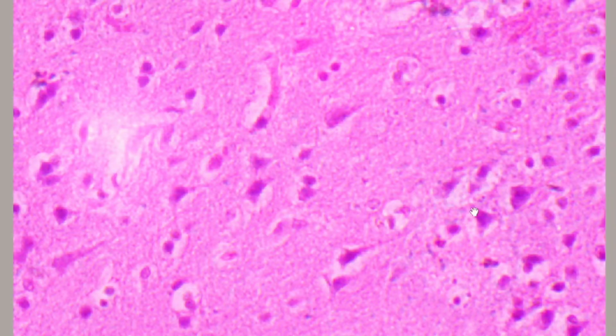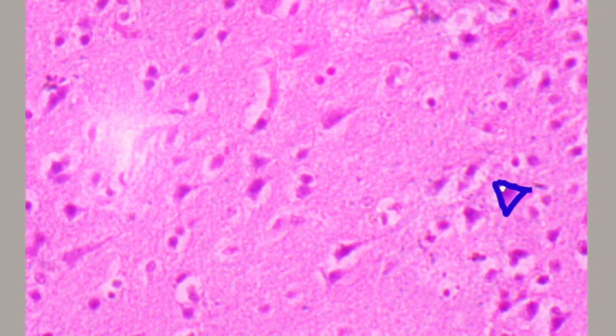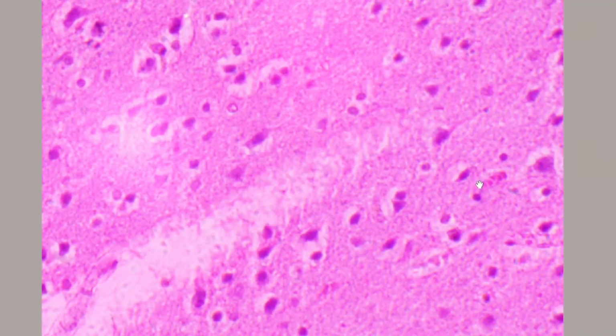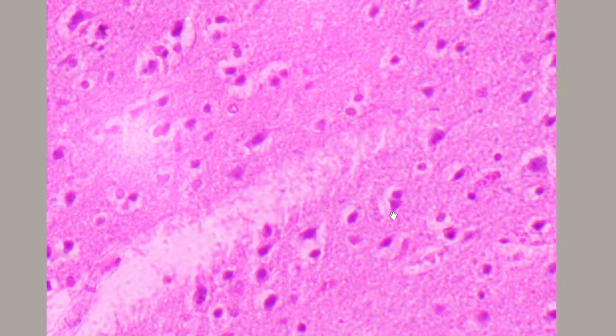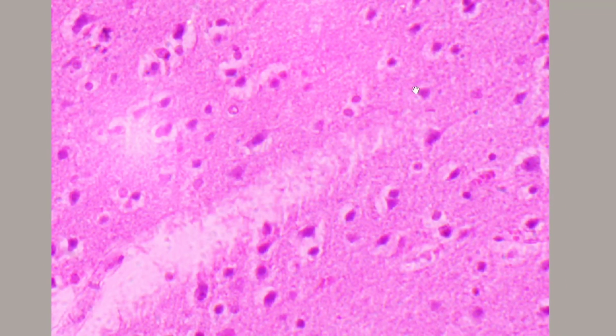So my dear students, whenever you are having the cerebral cortex, you should make sure that you are able to identify such kind of triangular bodies of these cells. And if you are able to identify even one or two such triangles in your exam, it is more than sufficient to label this slide as a nervous tissue, and in the nervous tissue, most of the time you will have the cerebral cortex slide in your hand. So again you can see here, this is a triangle. Here also you can see that this is one more triangle.